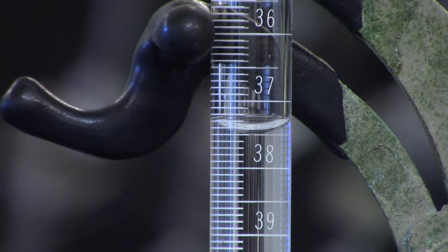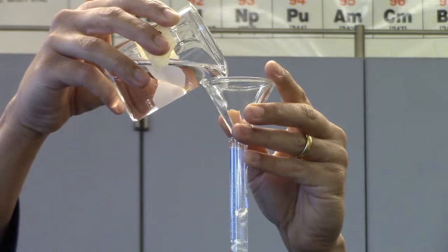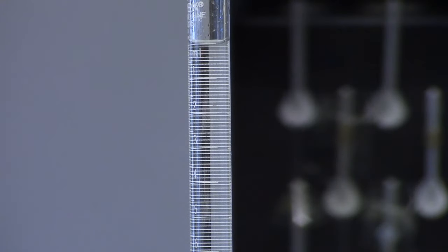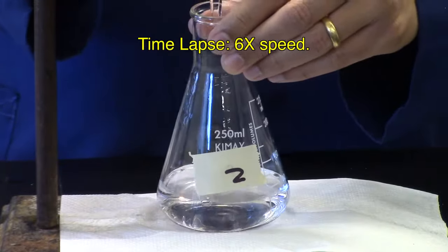Record the final burette reading. Refill the burette. Record the initial burette reading and titrate the second sample to the pale pink endpoint.